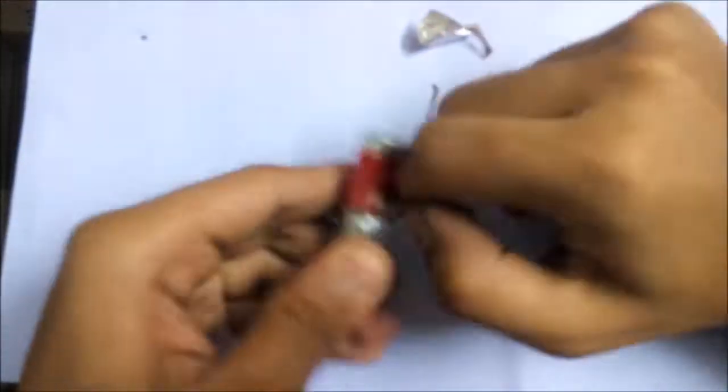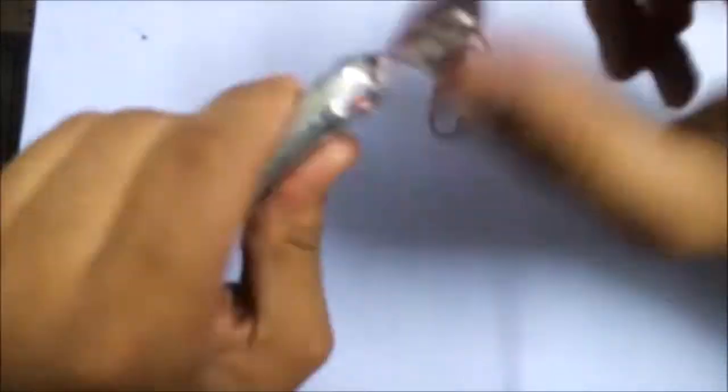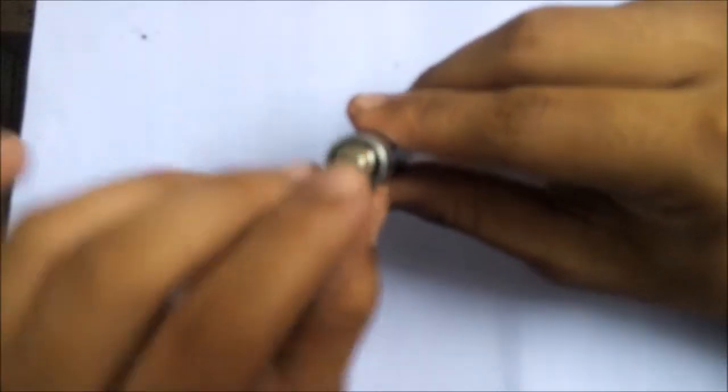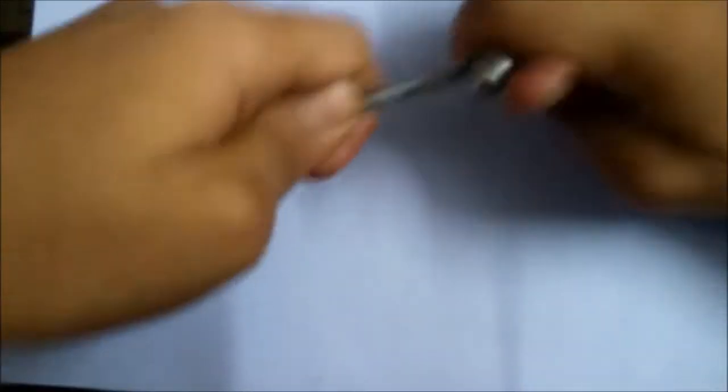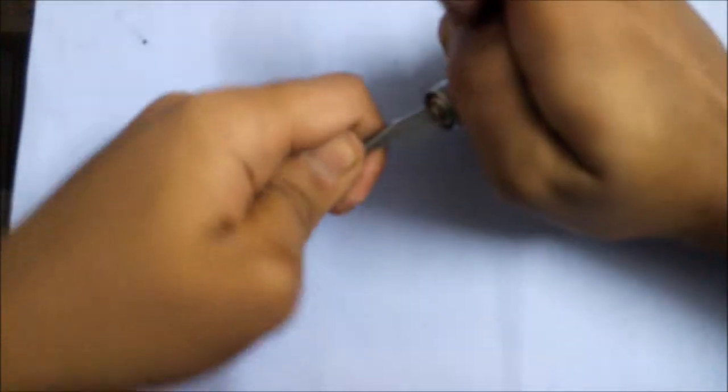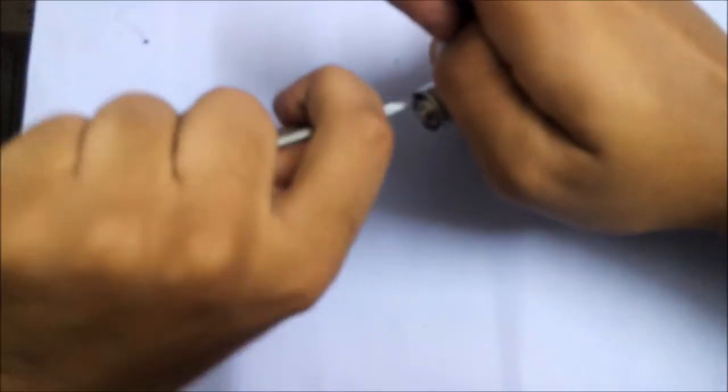Now the next thing is to take this cap out. For this, I can take it off using a screwdriver. You have to be very careful. You should not injure your hand.